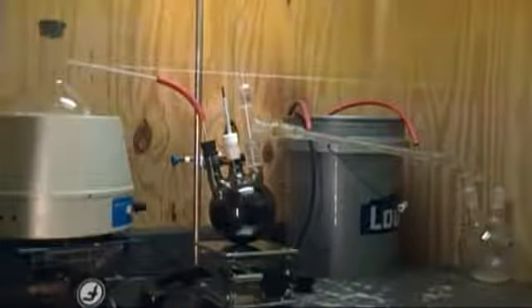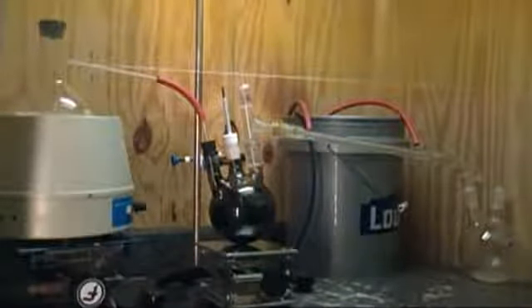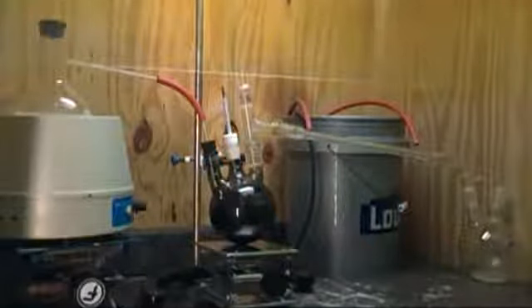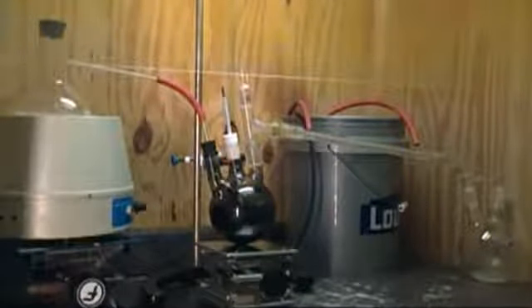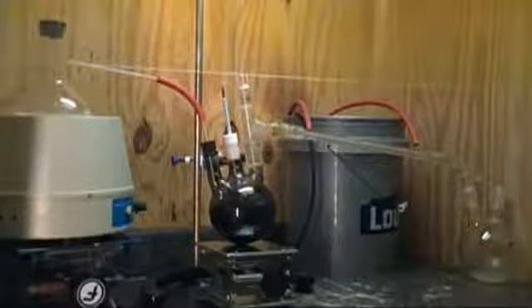You can see how I did it here with a retort, a hose, a glass rod, and a stopper. The glass rod goes all the way down to the bottom of the boiling flask. The rest of the setup is just simple distillation. After setting up, turn on the heat to your steam generator and after some time it will begin to produce steam that will enter into the reaction flask and distill over the crude aniline.